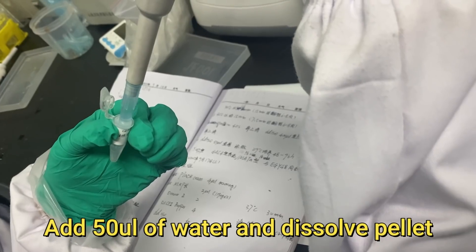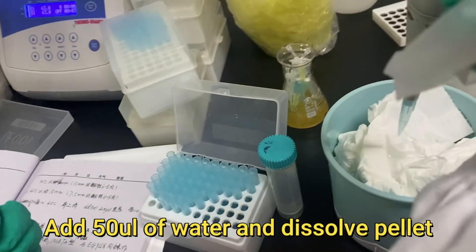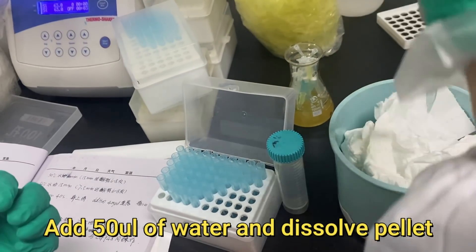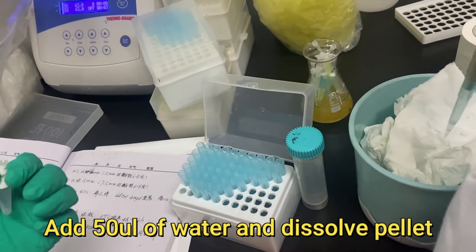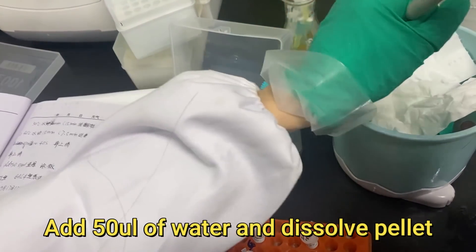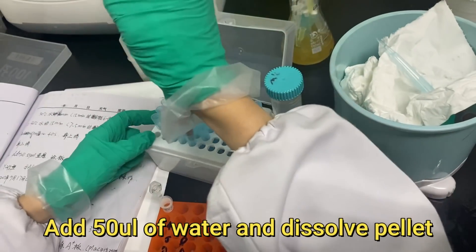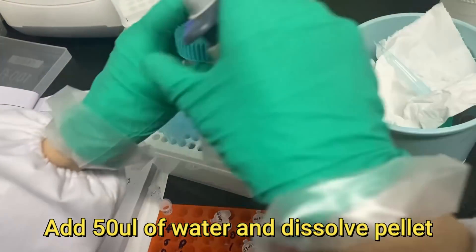All the supernatant should be removed. Please take care — we should not remove the pellet. We should only remove the supernatant.